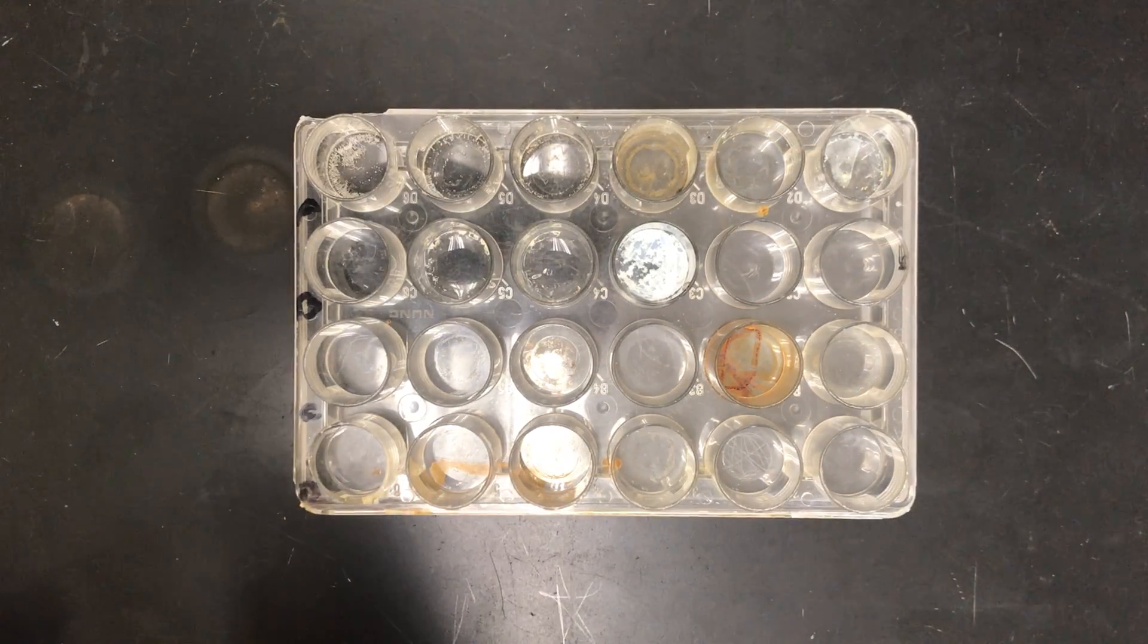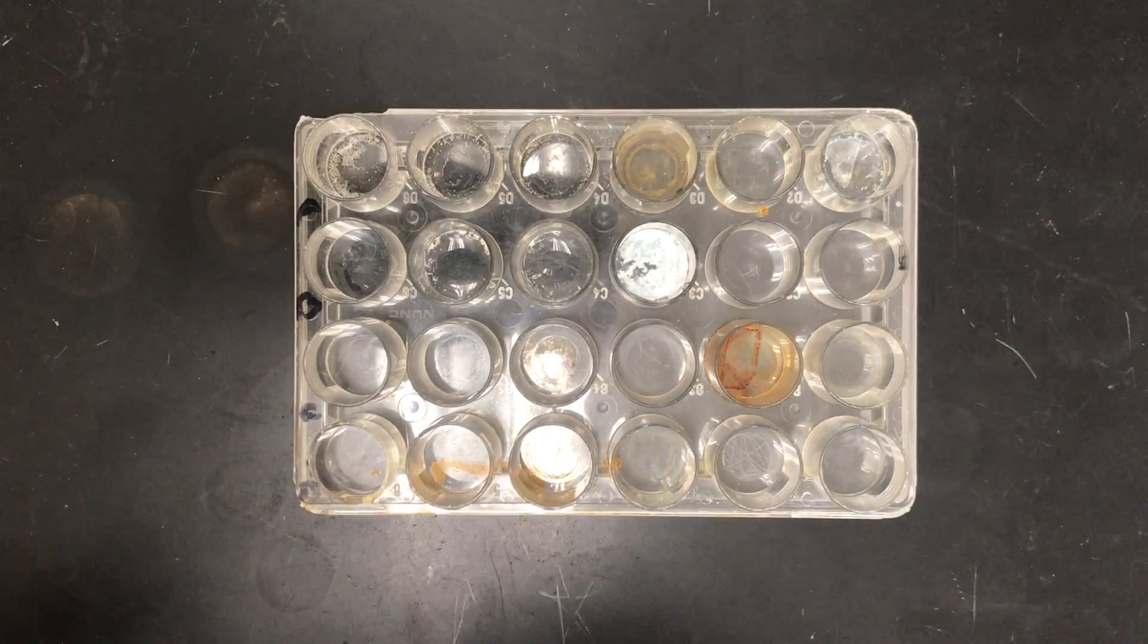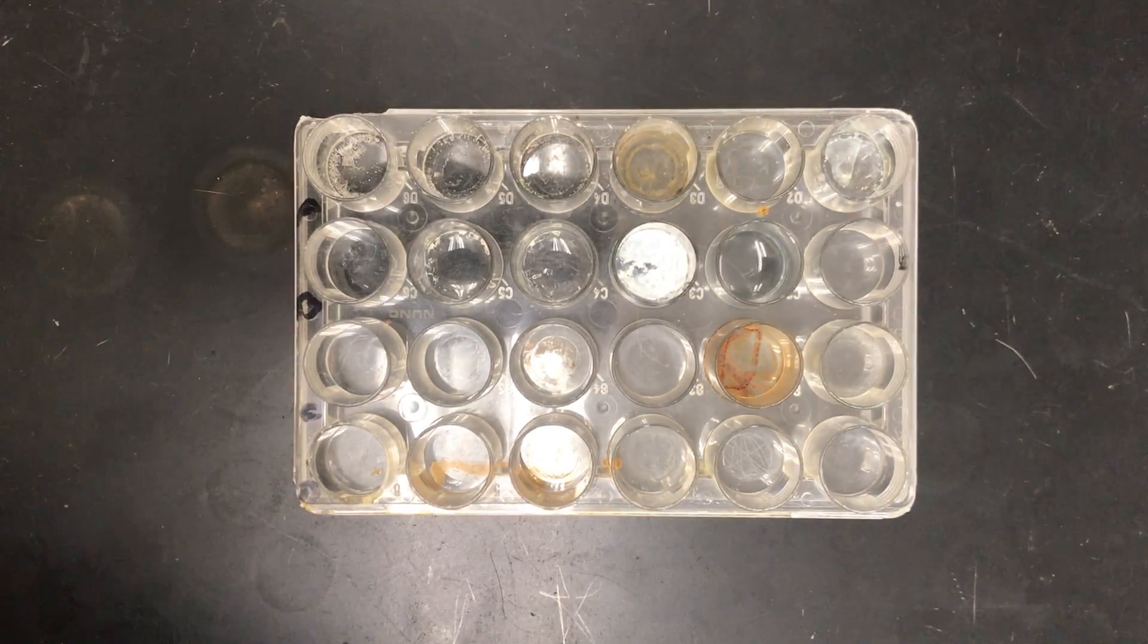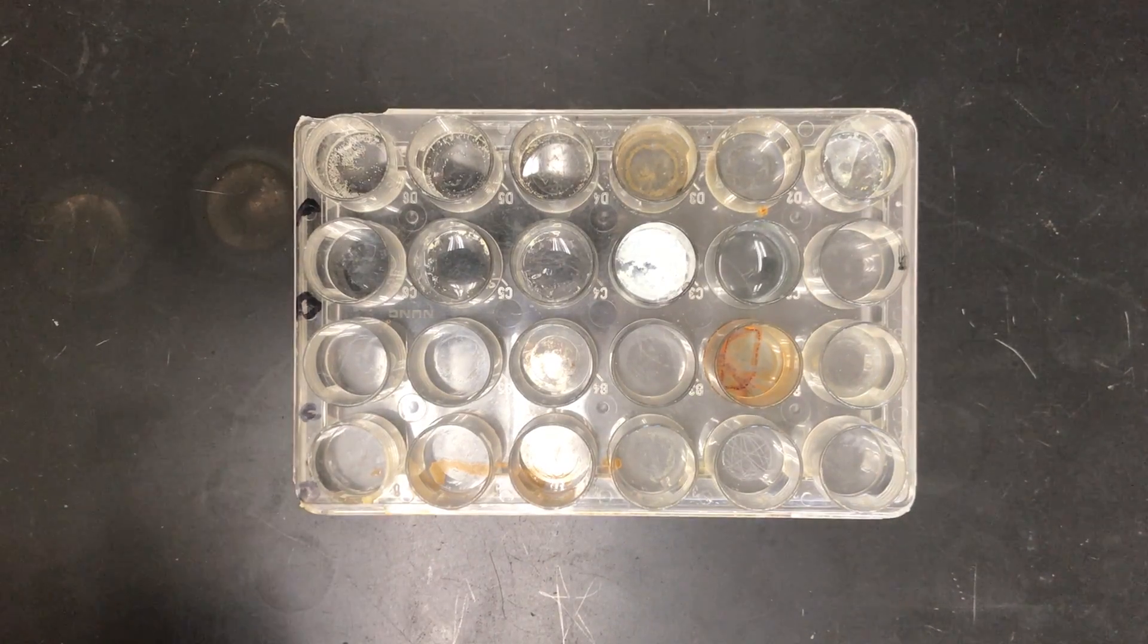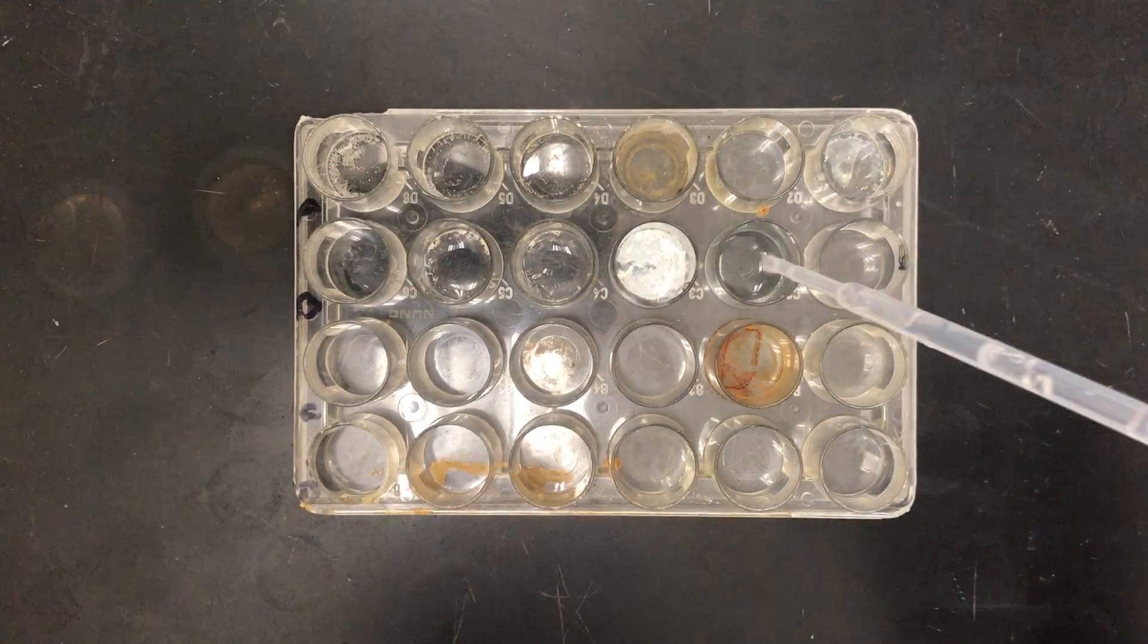Make your observations there. And silver nitrate and sodium carbonate. So that was silver nitrate that just went in, sodium carbonate here.